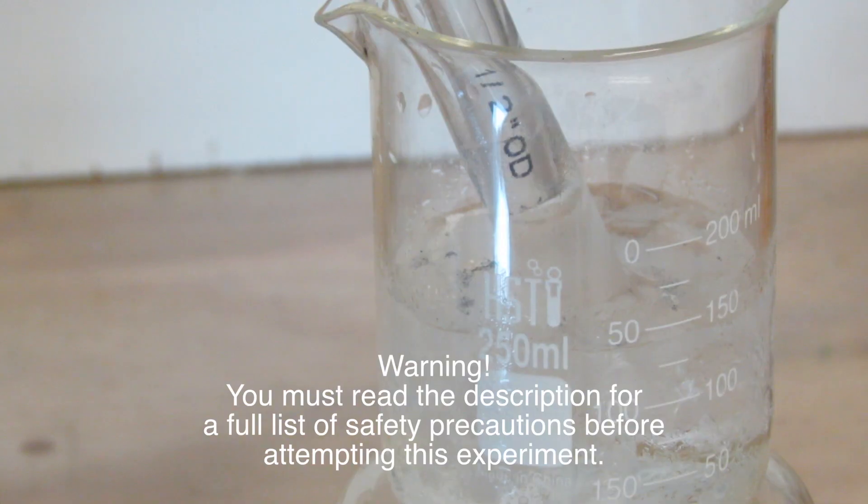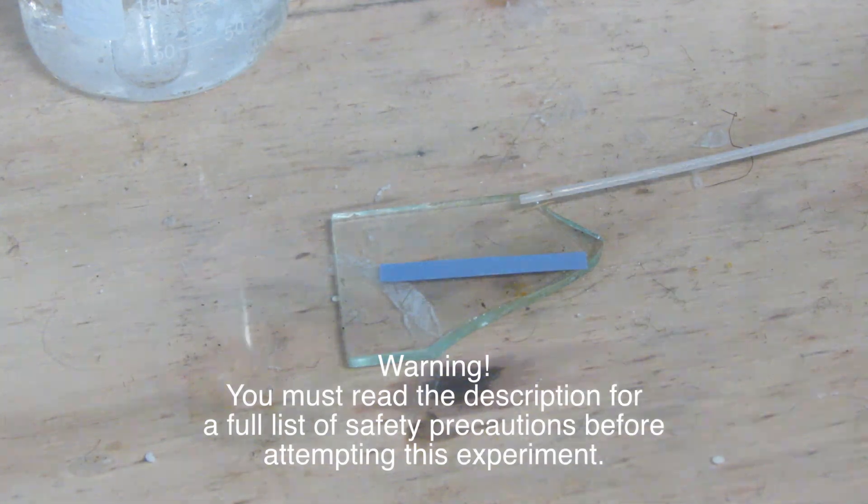Hello, this is GooferKing and today we are going to be making hydrochloric acid with easy to find chemicals.